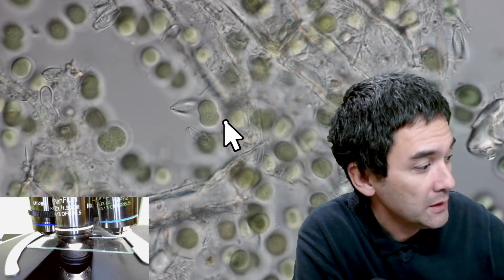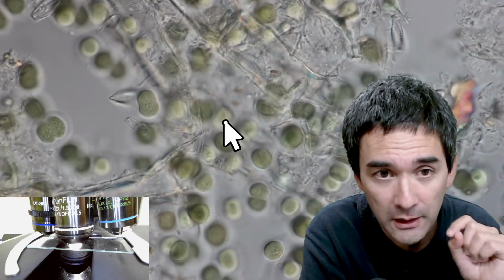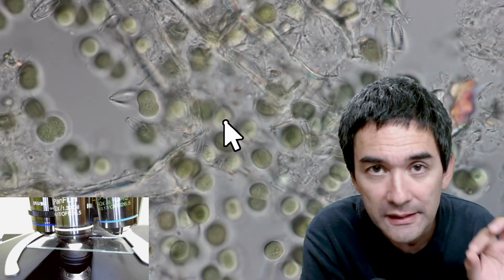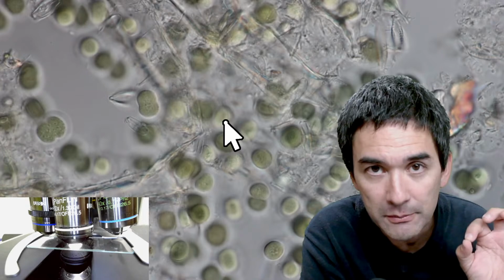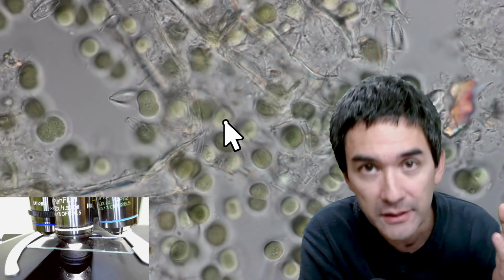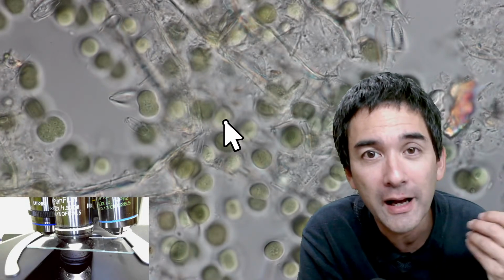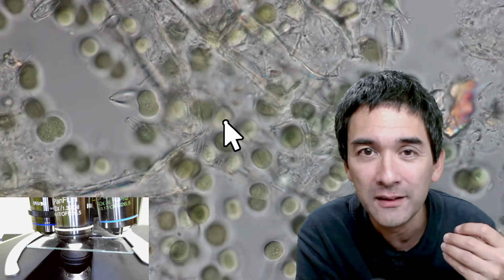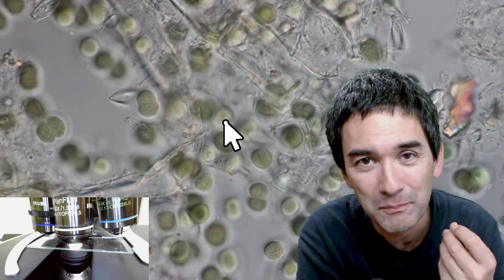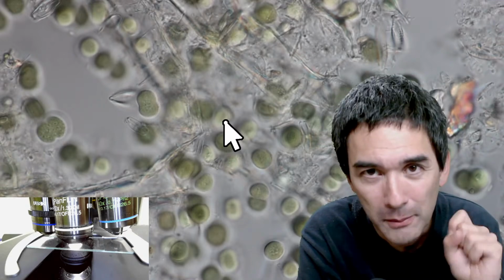Yes, it is possible to use immersion oil on a cover glass, and it is also possible to use immersion oil instead of water as a mounting medium. Why would you do that? Some specimens, I give you an example, like birds' feathers, are very hydrophobic. They're oily, they're fatty. And if you add some water, and you want to make sure that there's water around it, it won't work because the feathers won't attract the water. And there are a lot of bubbles.